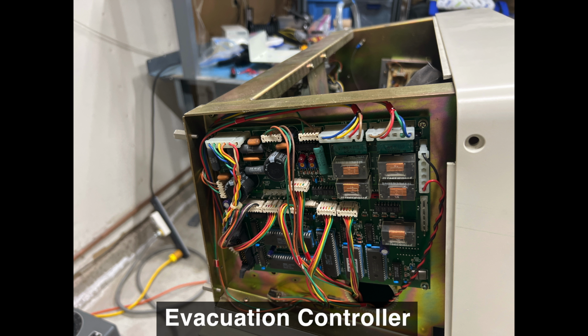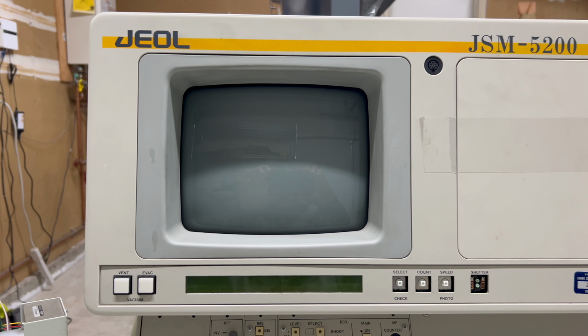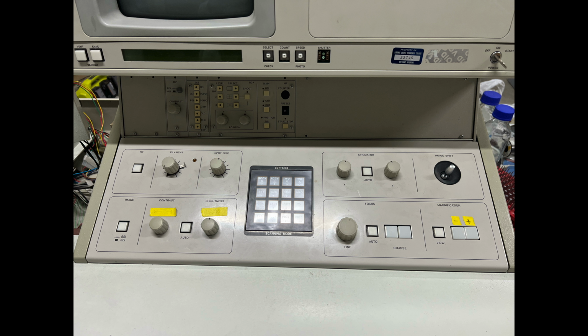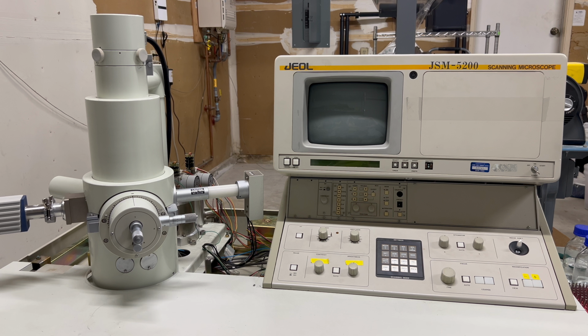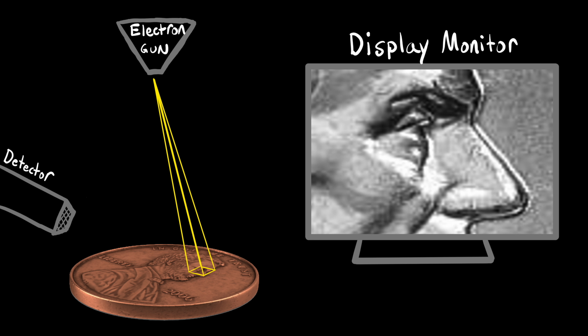In addition to that, we also have digital circuitry, in the form of a rudimentary computer that manages the valves and other components and keeps the SEM operating smoothly. Finally, we have the user interface, made up of the main display which shows us the image, and a small LCD which shows us the system status, as well as a bunch of knobs and buttons which allow us to control the focus and magnification of the microscope. And that's basically everything. Okay, so we finally have the microscope, the documentation, and a rudimentary understanding of how this machine is supposed to work.